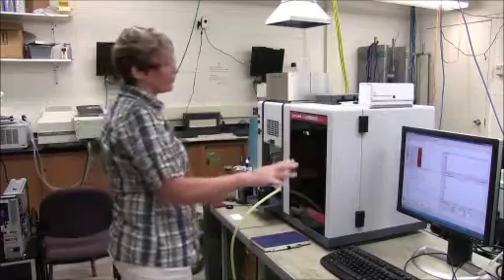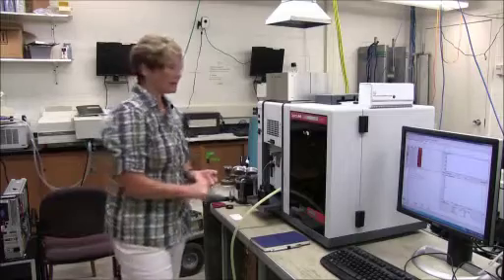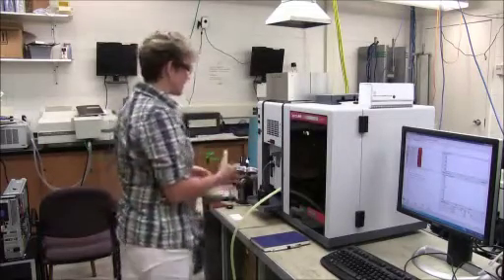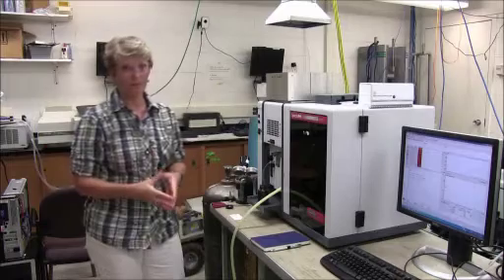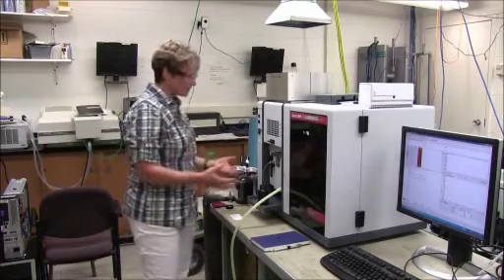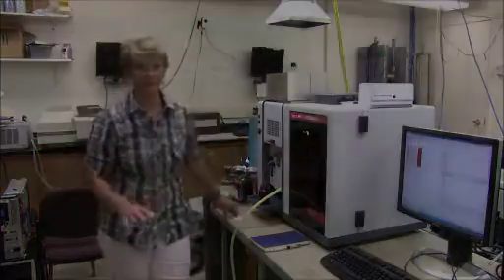So we'll have set up the software with the method that we want. We'll have set it on a wavelength of interest that the lamp is set for. And then the next is to actually introduce your sample. So as I mentioned, we want all of your samples in the aqueous form. They can be a bit acidic. There may be some buffers in there. That's all fine as long as they're clear, colorless, and there's no precipitate at all.